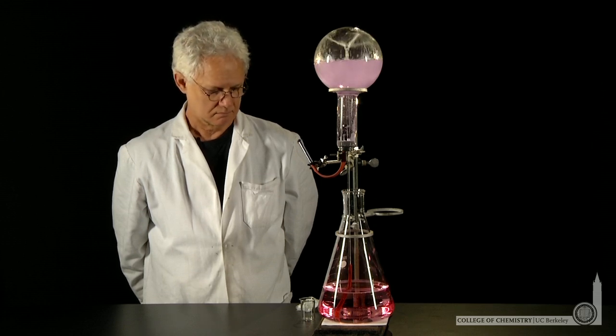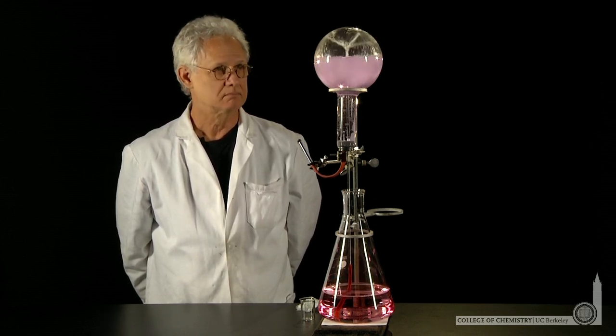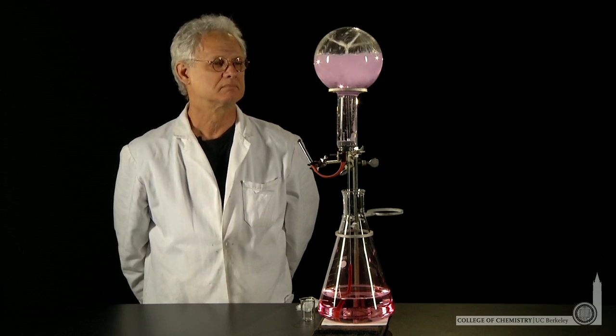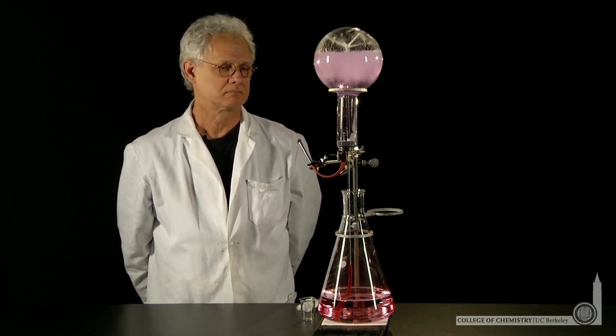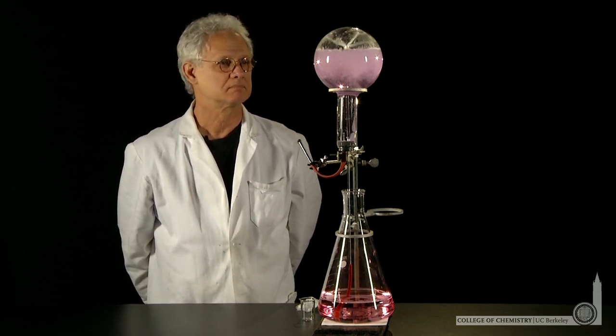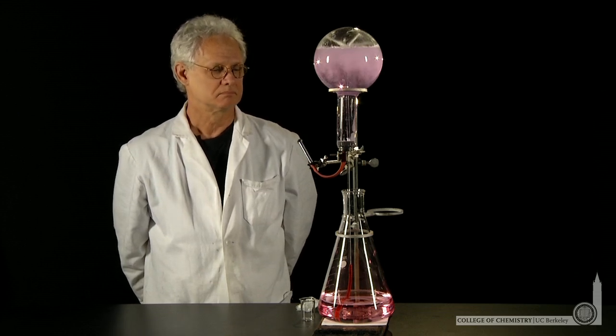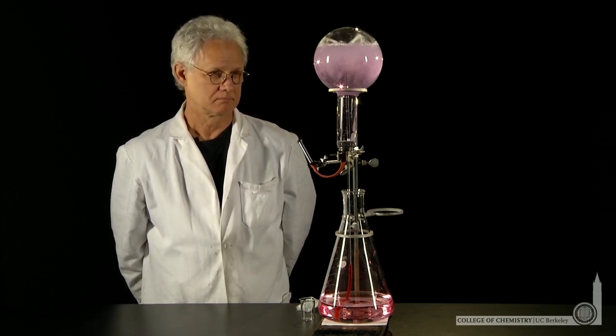In fact, it's a dramatic representation of the free energy released in this chemical reaction, as the free energy release can lift about a kilogram of water almost a meter high from the lower flask to the upper flask of the fountain.